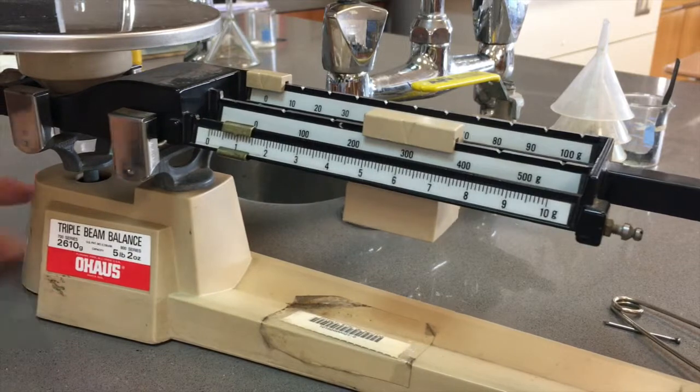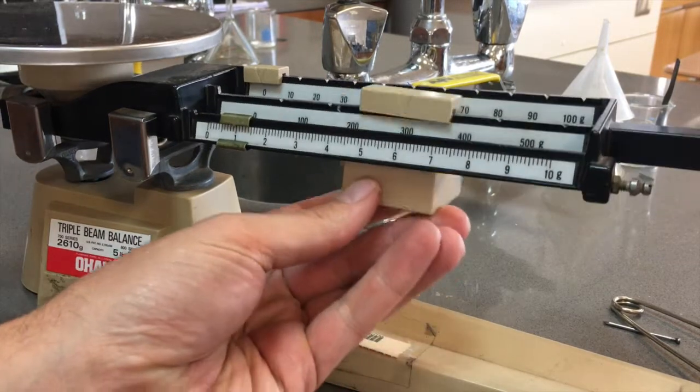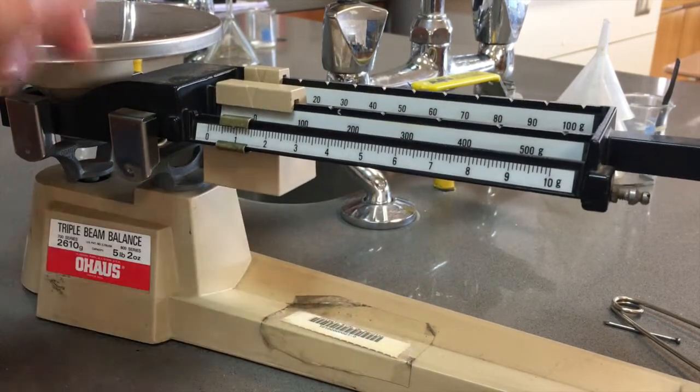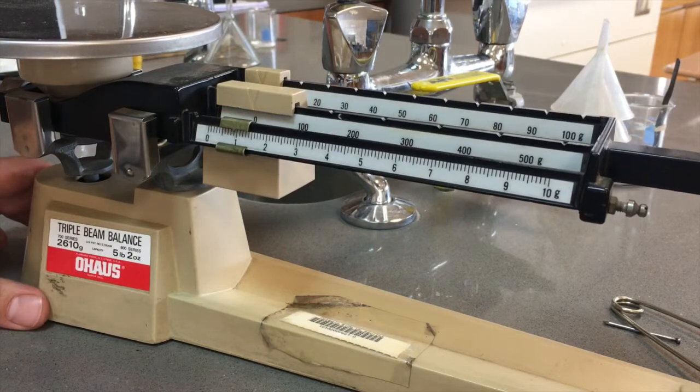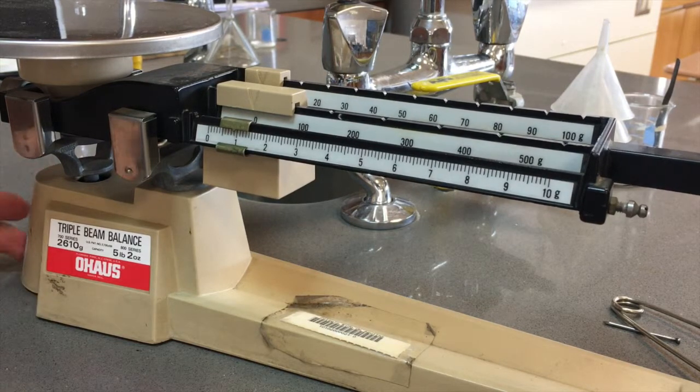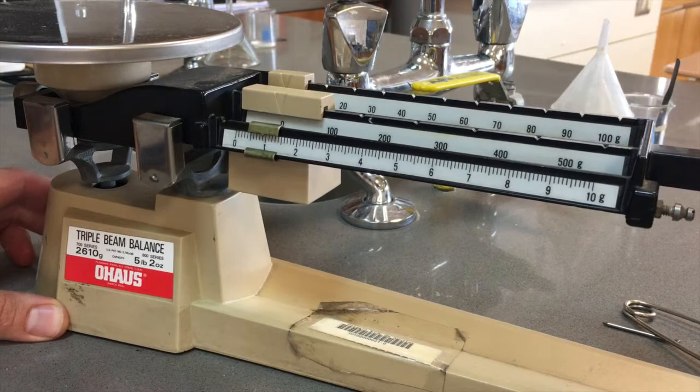Okay, so this is the triple beam balance. Now, triple beam balances are a great instrument for measuring the mass of something, and it kind of goes back to the old way that people used to measure mass.